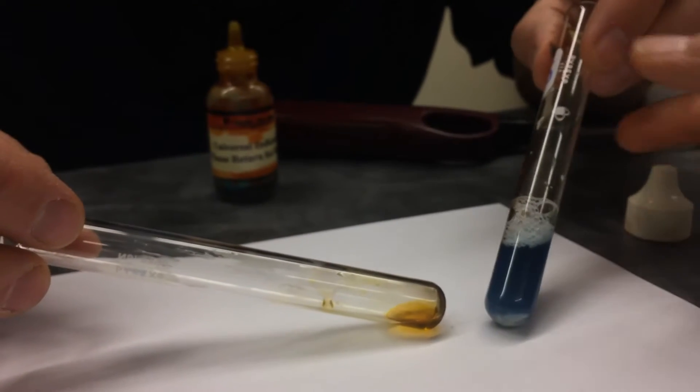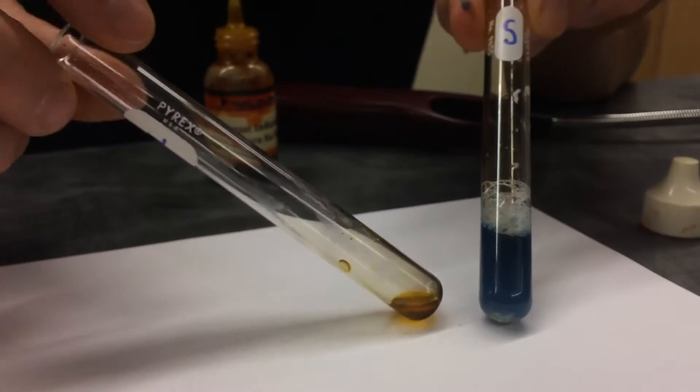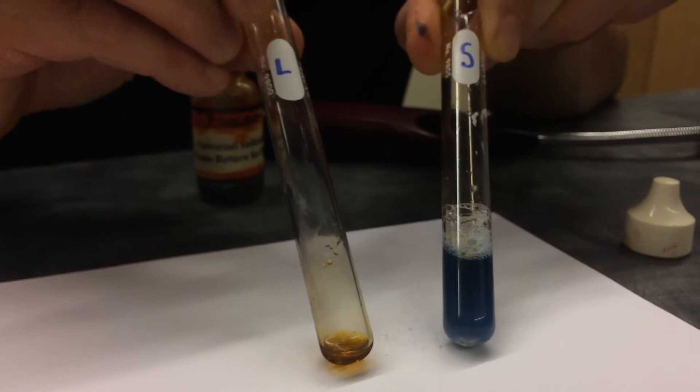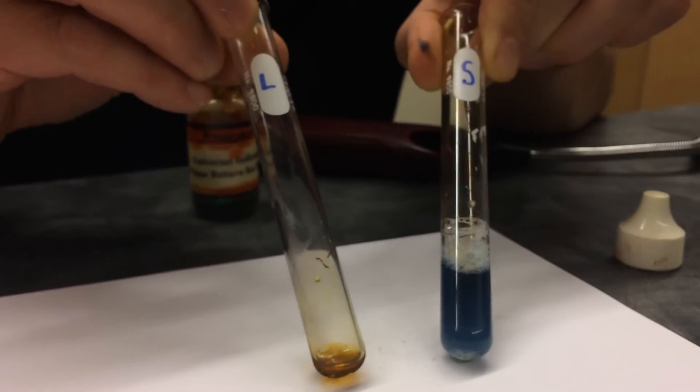Can you turn this here to show me the letter? That way they know. Oh, I'm sorry, yeah. There we go. So, L for lard, S for soap. All right. All right. Now, the moment of truth.